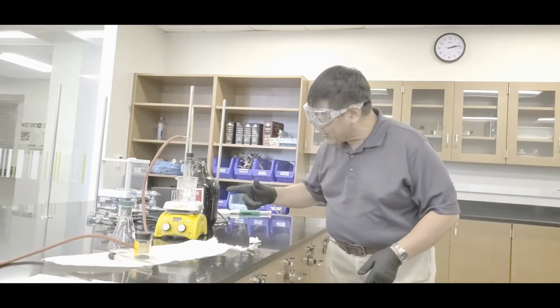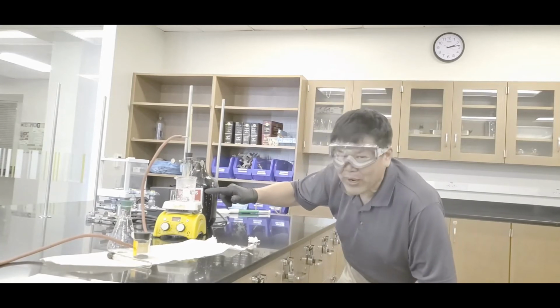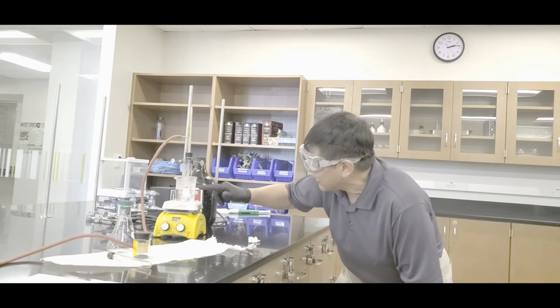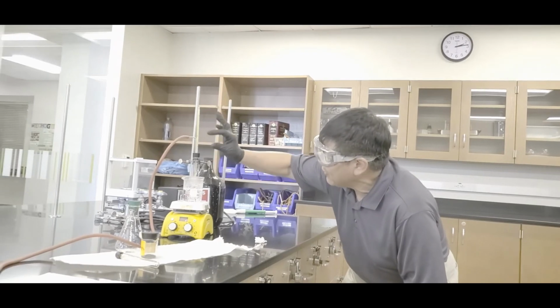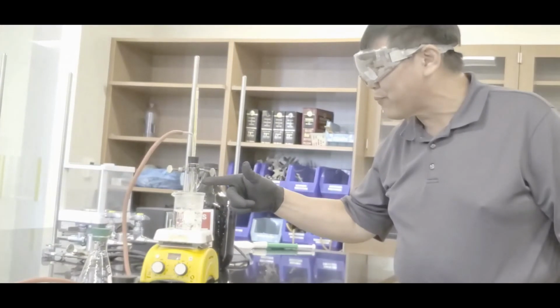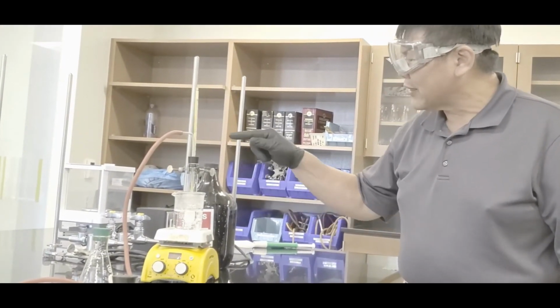So what you got right here is that the water's boiling, and if you look inside, the liquid is fizzing in there. And then you see gurgling right there. See the liquid's going back and forth like that? That tells you that you have both a liquid on the bottom as well as a vapor on top. So once you have the coexistence of the two, the temperature is steady.